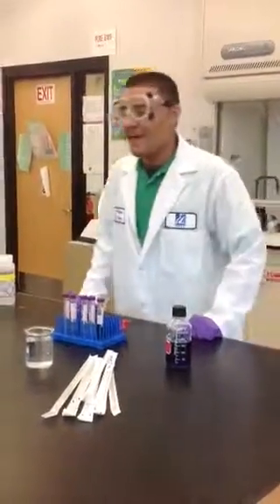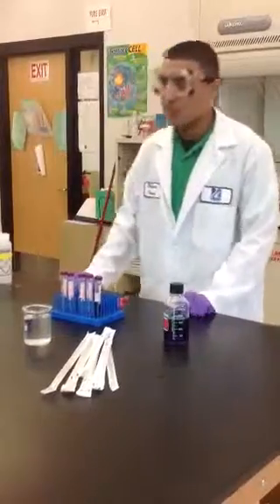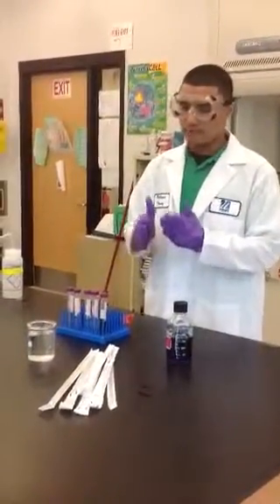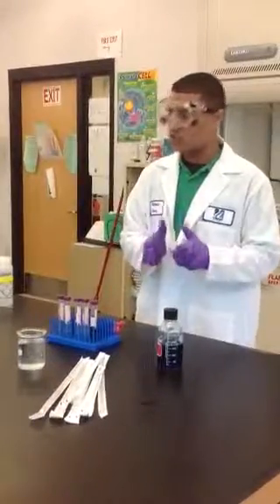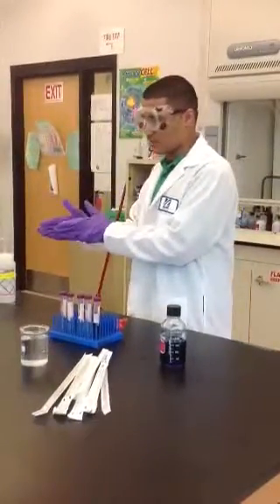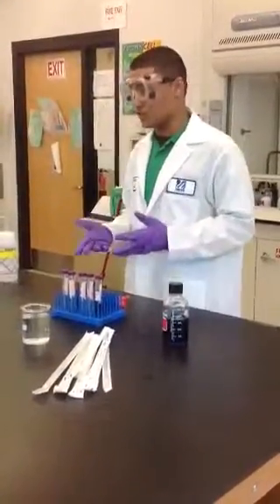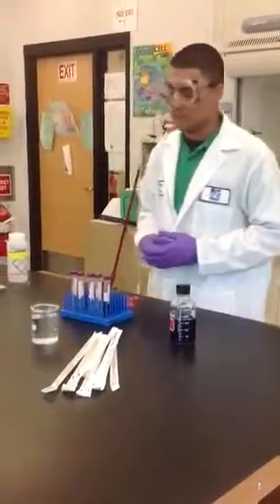A.K.A. Melanie Lemoy. Today I'm going to be doing a serial dilution. A serial dilution is basically a pipetting technique where you have one concentration for the stock solution, and as you progressively go on by the tubes adding water, the concentration becomes weaker by a certain ratio depending on what you do. In this demonstration I'll be doing a one-to-two dilution.